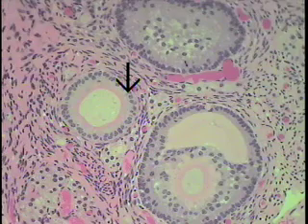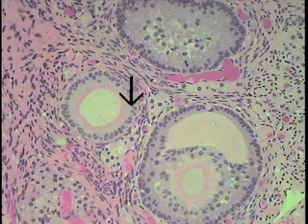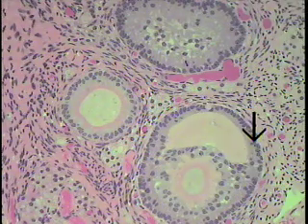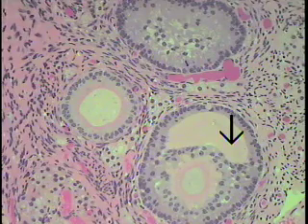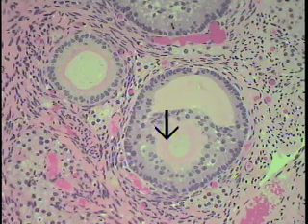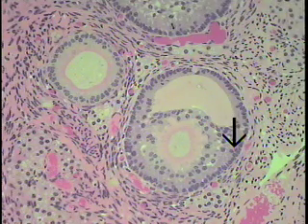This is a region of several other maturing or growing follicles seen at slightly less magnification. One is shown here — you can see how the follicular cells are beginning to stratify. You can see a larger one here, and then another growing follicle with the development of a layer of follicular fluid, or an antrum, a collection of fluid within this particular follicle. When that antrum appears, this form of maturing follicle is referred to as a secondary rather than a primary follicle. We can just see a nick through the zona pellucida and the contained lighter-staining oocyte, as indicated by the pointer.